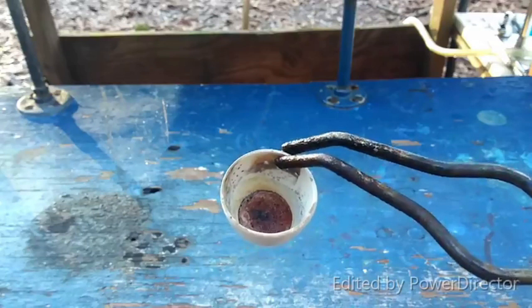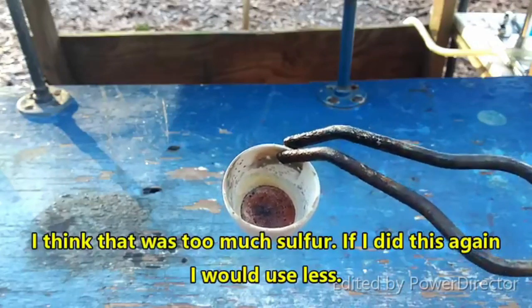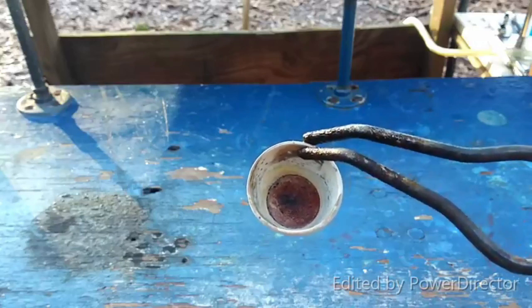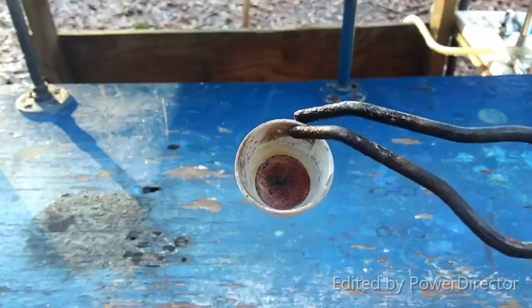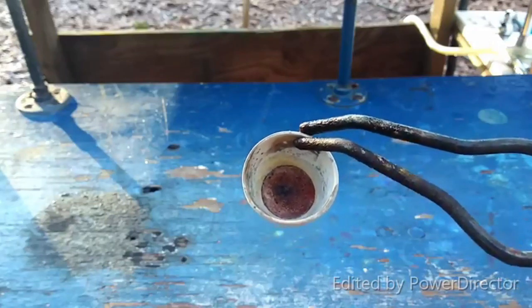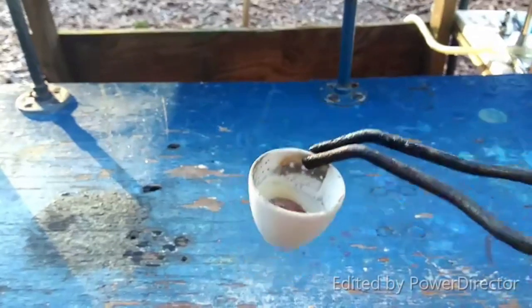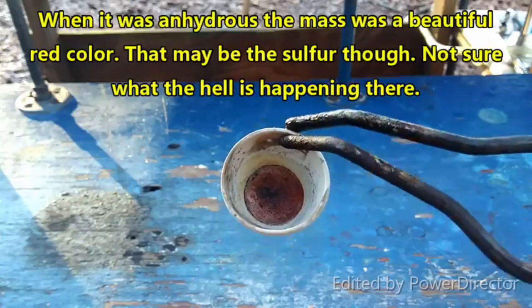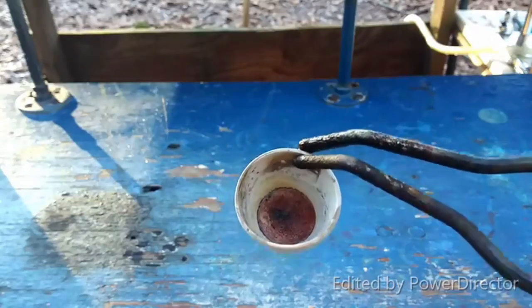I cooked it for a couple of hours and added a little more sulfur — two extra scoops — and let that burn away. Last night it was a clear reddish compound, almost like a reddish glass with a dark spot in it. This morning it had completely become hygroscopic, and as it absorbs water it gets dark — not quite blue, more like a dark bluish-gray. We're also getting a nice red out of it, and there's no sulfur smell when you heat it up, so I don't think there's excess sulfur in there.